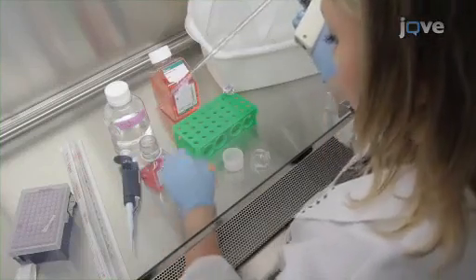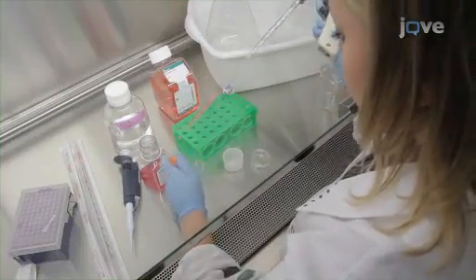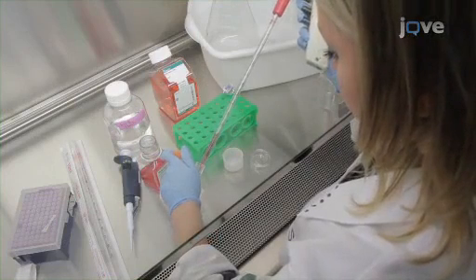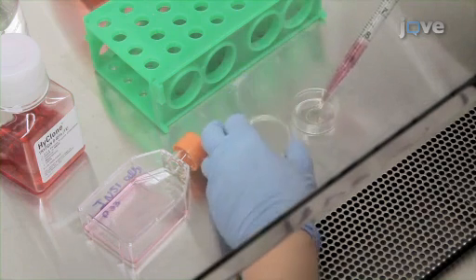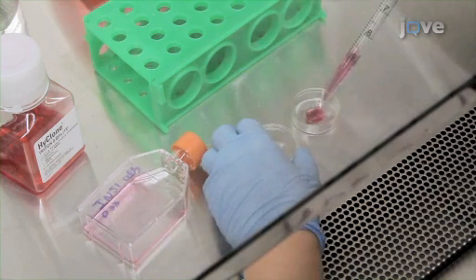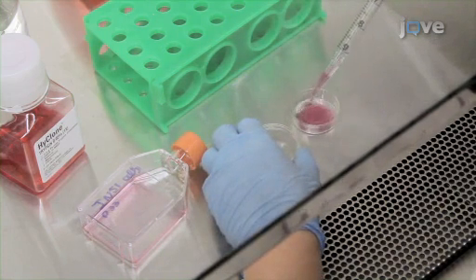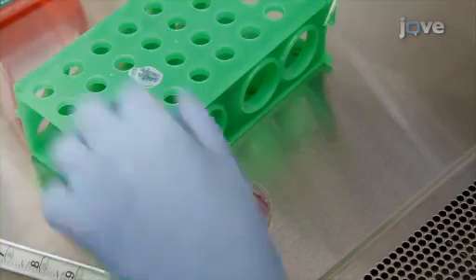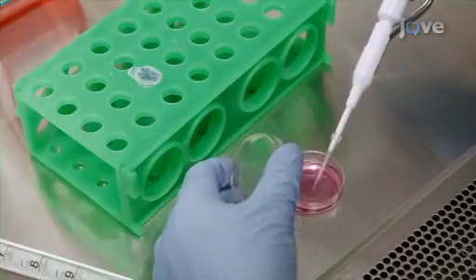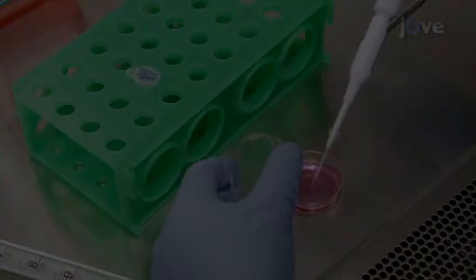After culturing INS1 cells to 80% confluence, detach the cultures with 0.05% trypsin and plate the resuspended cells onto poly-D-lysine-coated coverslip-bottomed imaging plates. After 2 days of culture, add mitochondrial matrix-targeted adenoviral photoactivatable GFP to the plates.